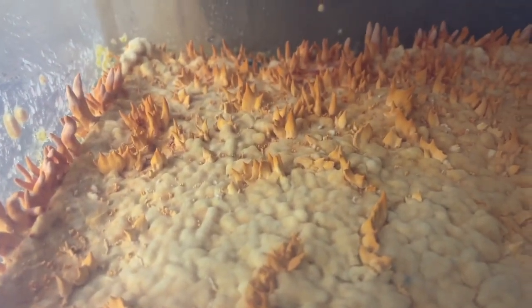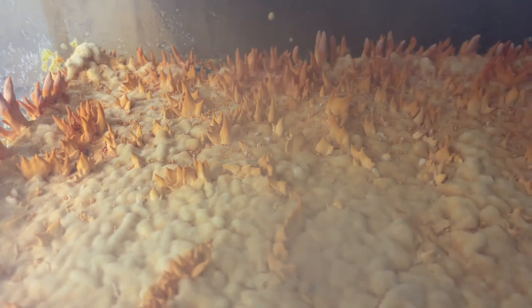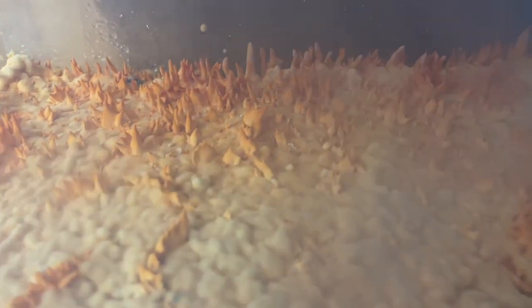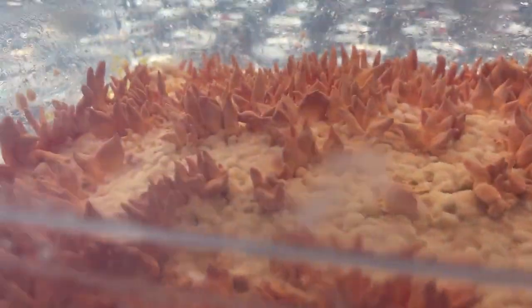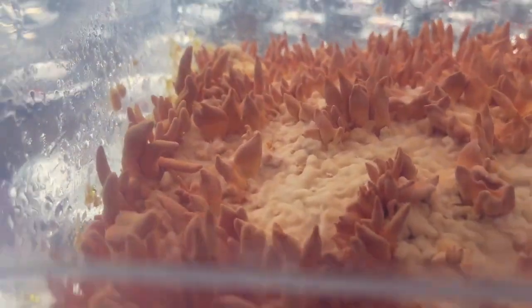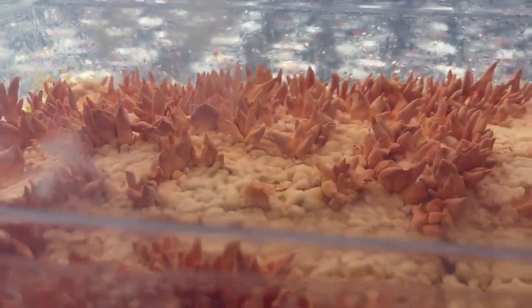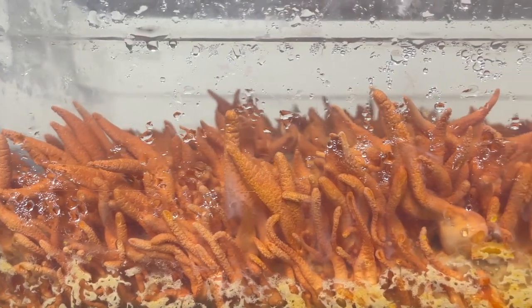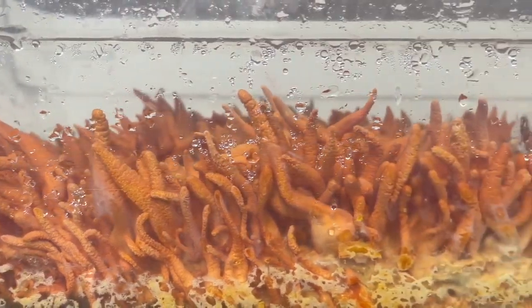After about 14 days, you should start to see some pinning. The cordyceps will be fully mature between the 50th and 60th day.